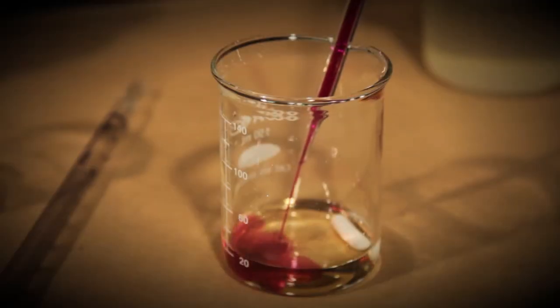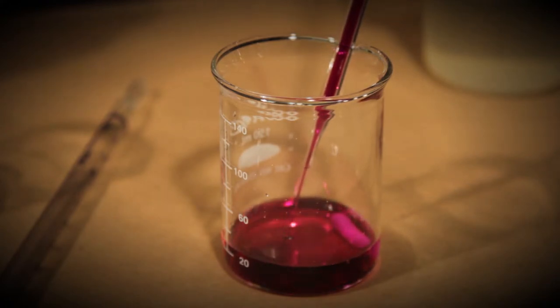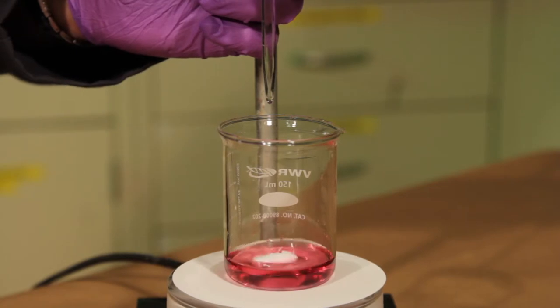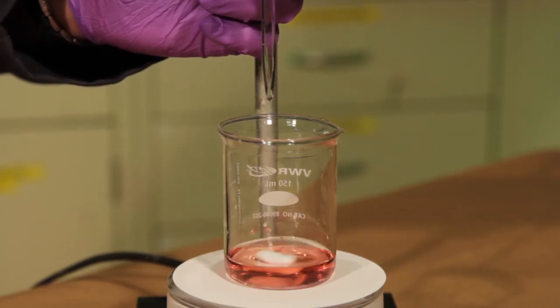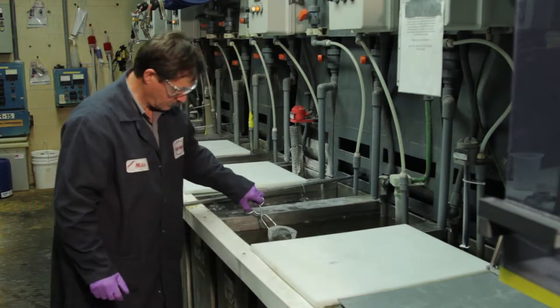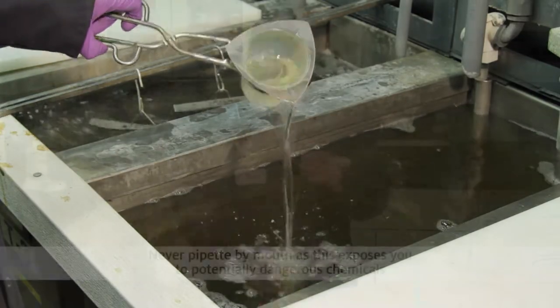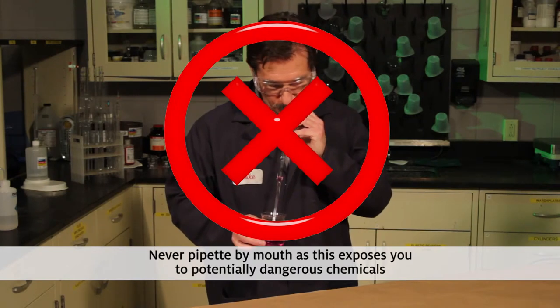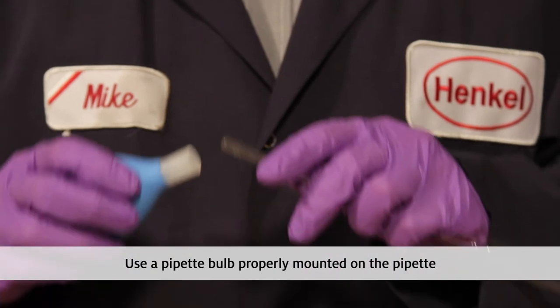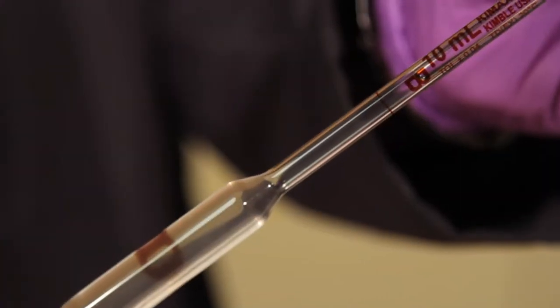For a reverse titration, the test solutions are used to prepare a standard of known concentration. We will add the production bath solution to the prepared standard in measured amounts. After you have collected a bath sample, you need to prepare the standard solution that you will titrate with the bath sample. Never pipette by mouth, as this exposes you to potentially dangerous chemicals. Use a pipette bulb, properly mounted on the pipette, to draw up the sample.